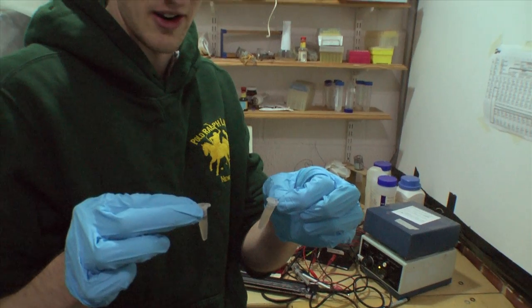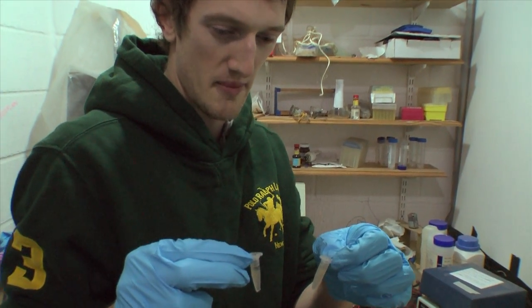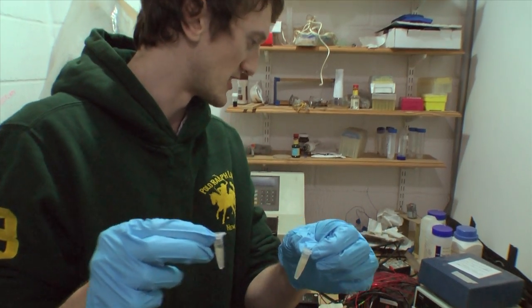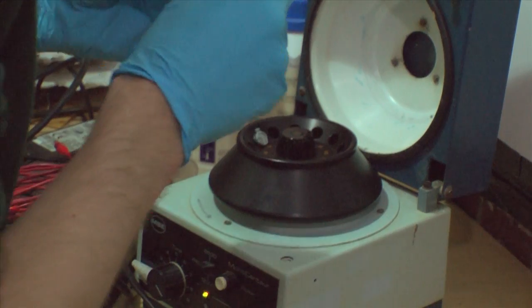These have just come out of the 100 degrees C incubation, so the DNA should be floating around in here now. So what we're going to do now is just put it in a centrifuge quickly to put all the solid at the bottom, leaving only the liquid at the top.